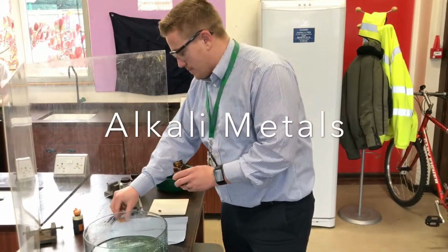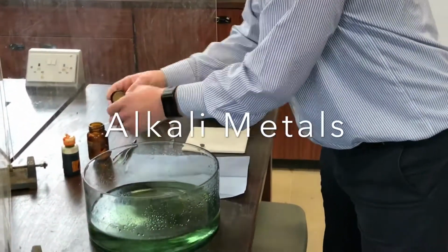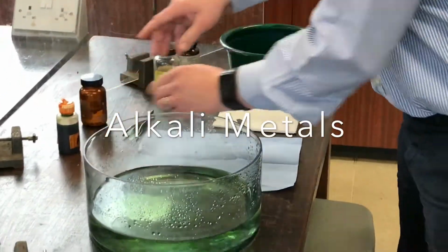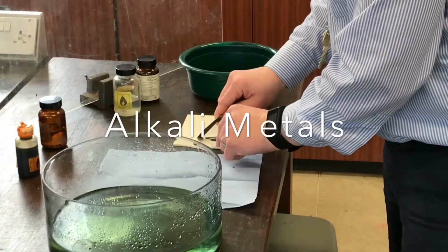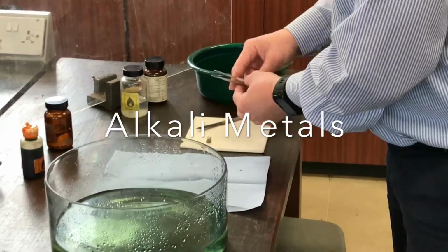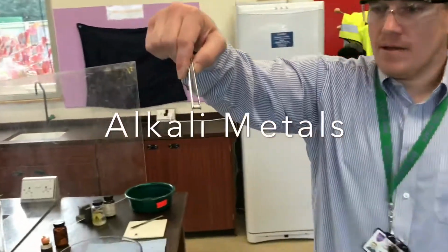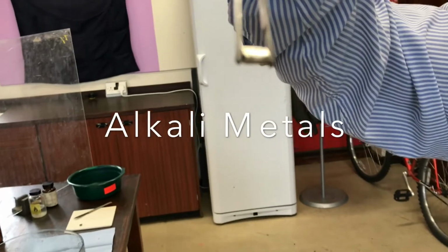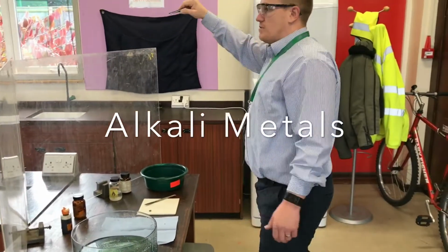actually looks like. So, if I just chop it up, I'm just going to make this safe, I don't want any more reacting with water. I just chop this up and we get a little zoom in on what it looks like. Very shiny. Okay, for the camera. Very shiny on the inside, you can put that in your description.